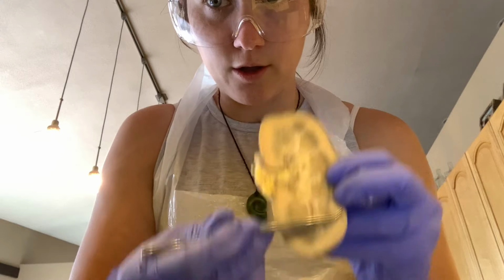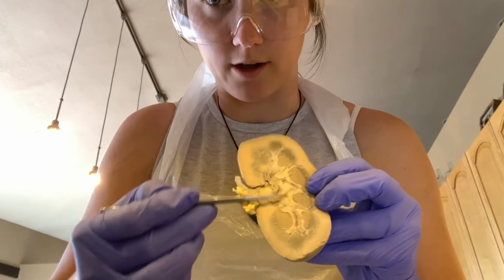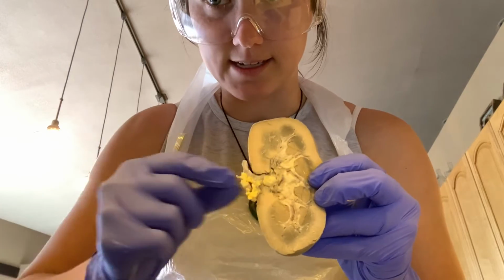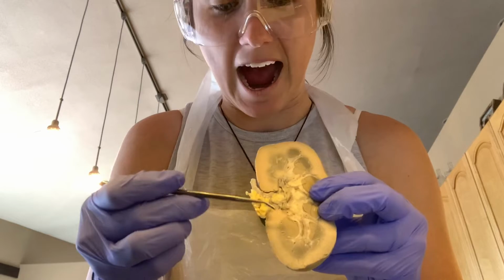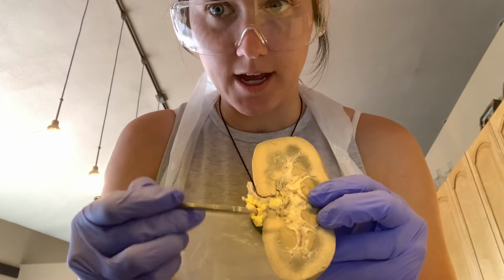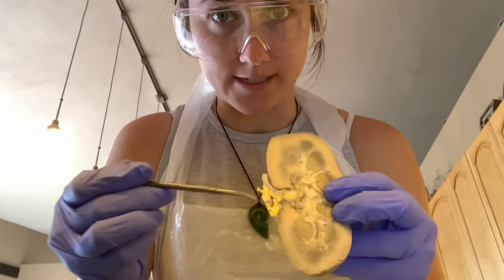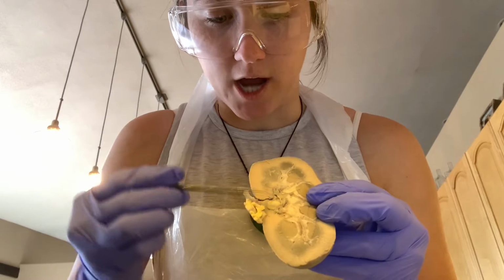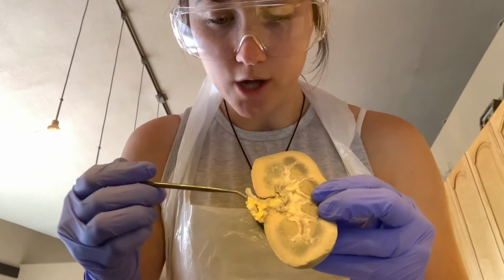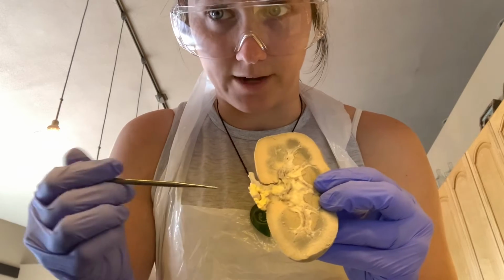And so all the urine is then funneled into the medial part of the kidney and then exits through the renal hilum, which is an opening in the middle medial part of the kidney here. And the renal hilum is important because it is also the entry and exit point for not just the renal pelvis, but also for the renal nerves, the renal artery, and the renal vein.